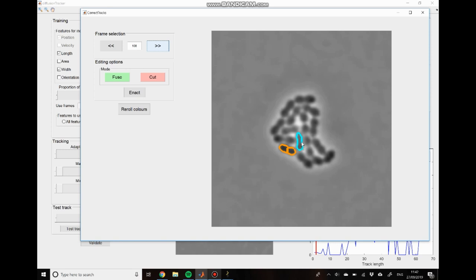So this is correct, and the division detection algorithm will deal with this, but just a warning that if you don't see something that looks quite like these prototypical divisions, not to be too worried and to just take a moment and think whether or not what you're seeing in later time points matches what you expect.